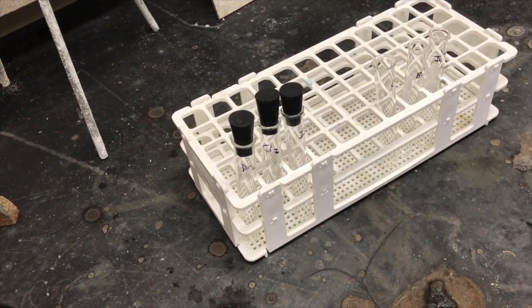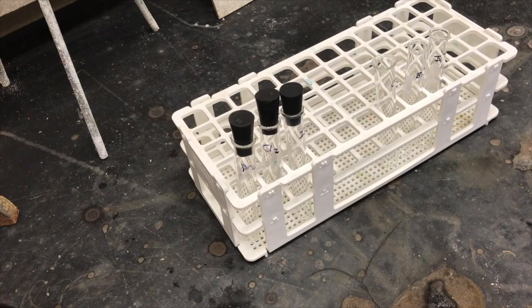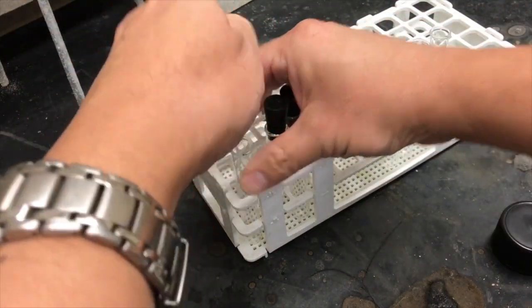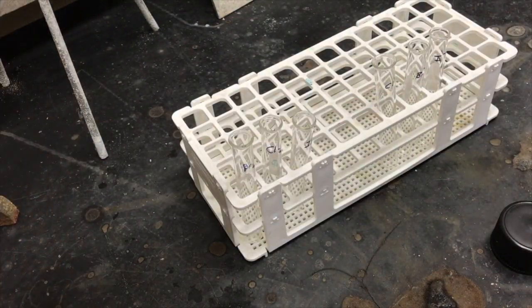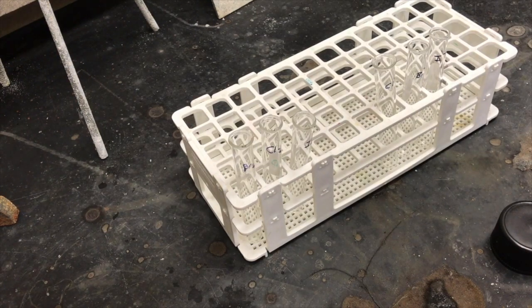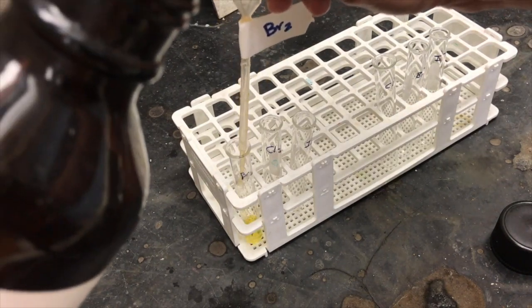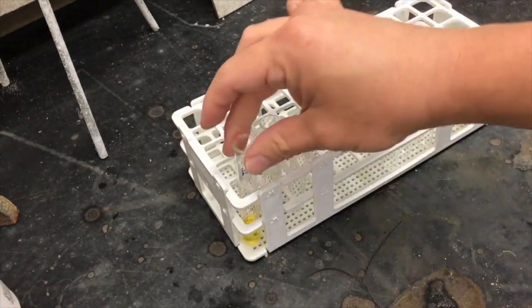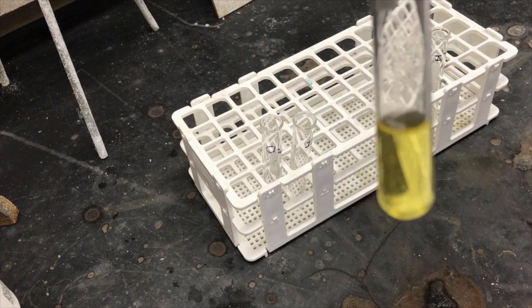In part B of this lab, we're going to observe the oxidizing strength of the different halogens. But first, we're going to observe what they look like. So I'm going to put a small sample of each of the halogens into a test tube so we can see them up close. We're going to start first with bromine. So this is bromine-saturated water. As you can see, it has a yellowish appearance.